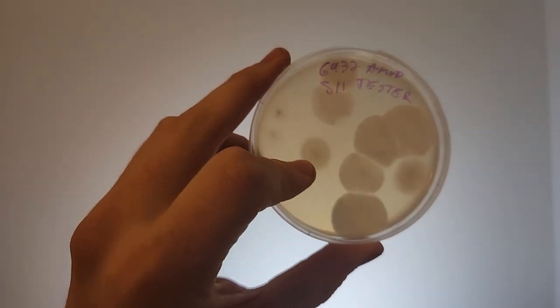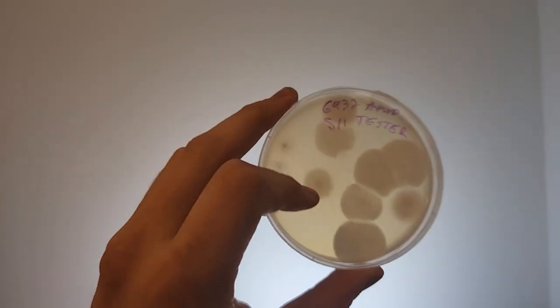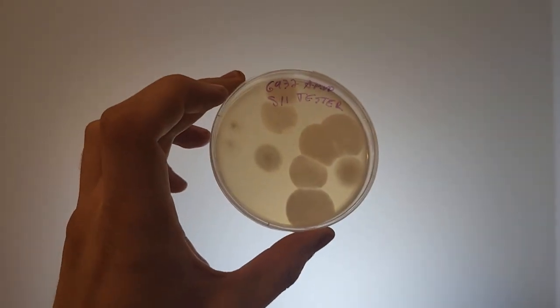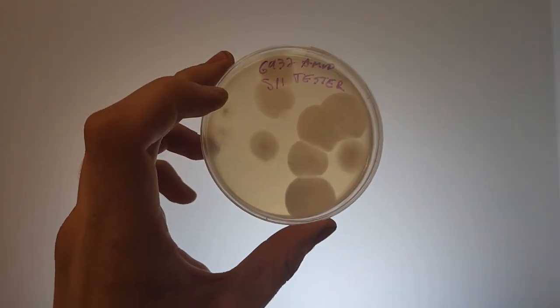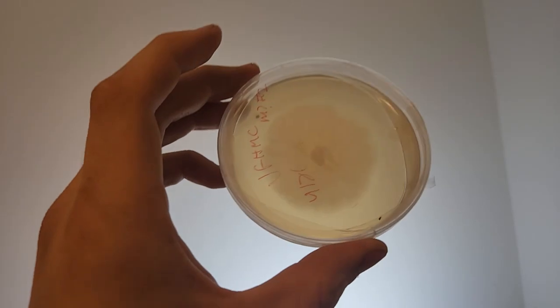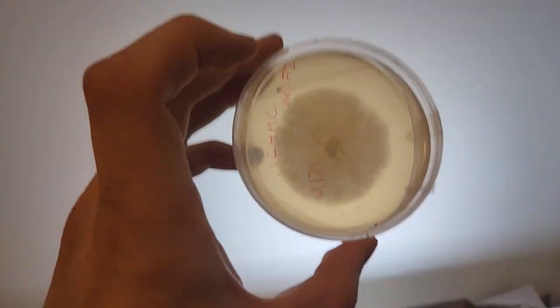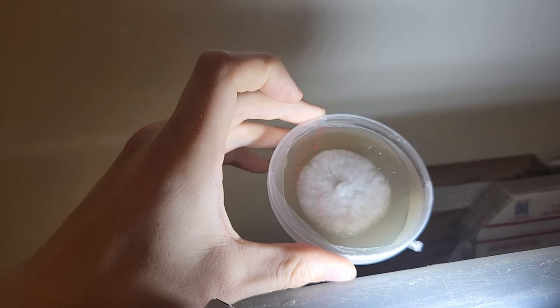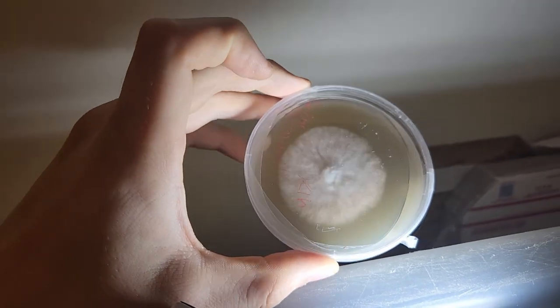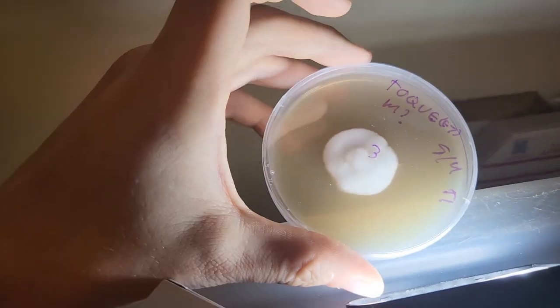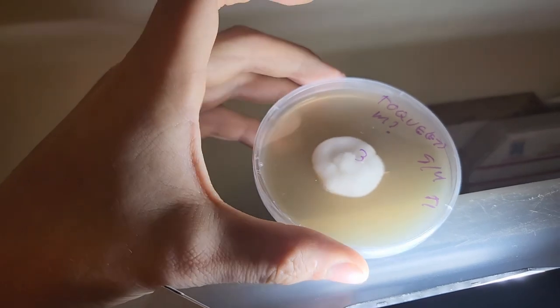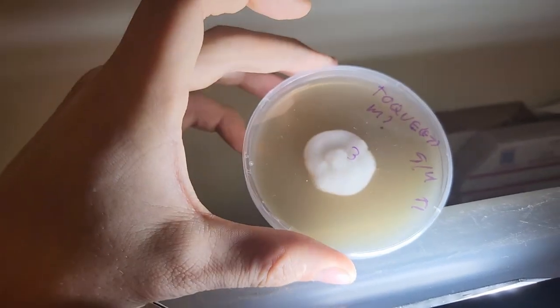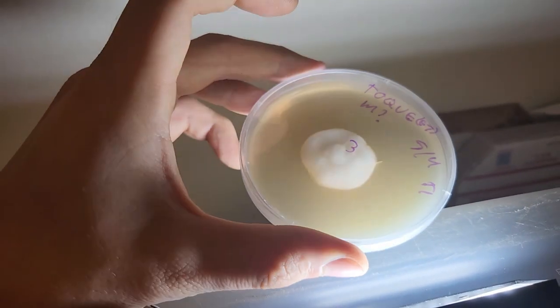They often look like that on a plate after you streak it out. There's a few different ways of isolating them. I find streaking is the easiest way to do it. So you take a transfer off one of those single spore germinations and grow it out. It will always be tomentose. It will never go rhizomorphic. If it does, it's not a monocaryon.